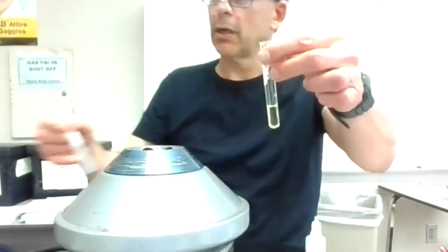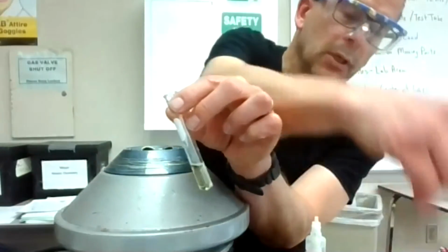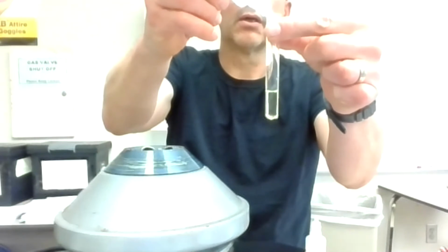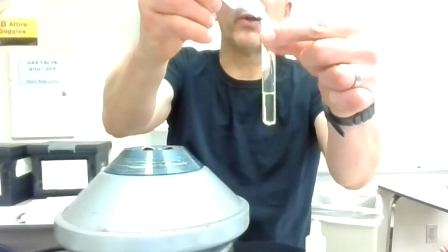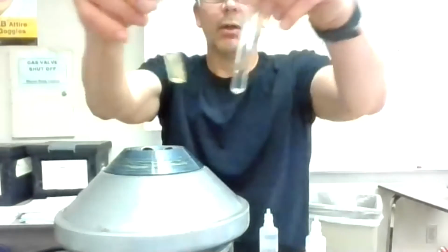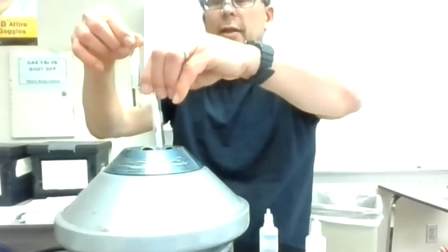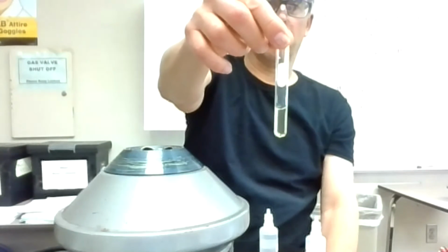So it looks like there was a precipitate formation in that third test. Now the fourth test, I should be getting cloudiness right away as I add the drops. I'm going to add CO3 minus 2. You see this oily stuff, but I don't really see a precipitate formation. It looks very clear. I know there's that yellow left behind, but you can see through both of them. So that's clear with this last test. There's no precipitate formation in this last test right here. So that is Unknown B.